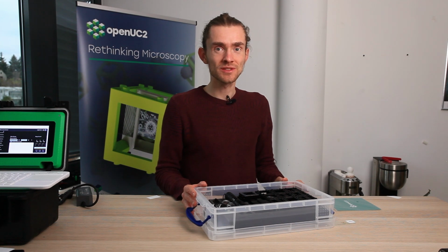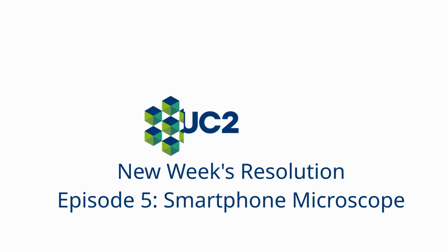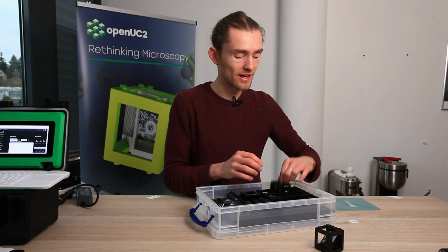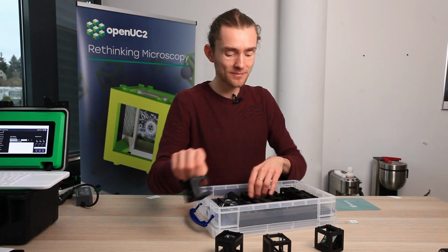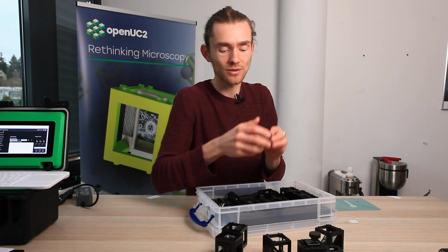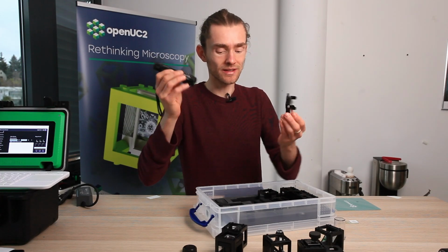Hello again from OpenUC2. Today we want to show you the most advanced experiment you can do with the core box, which is the smartphone microscope. And for this you need all kinds of optical elements. So you need the mirrors, an eyepiece, eventually also a sample mount. And what's also important is the part that moves the lens micrometer precise, of course the objective lens itself, and then a light and the smartphone holder.